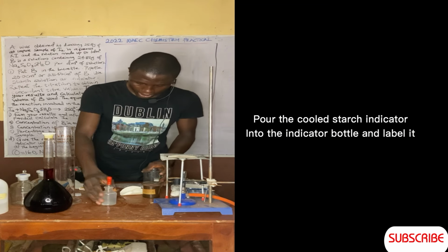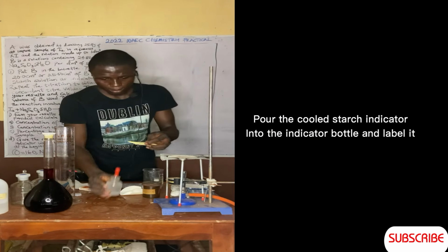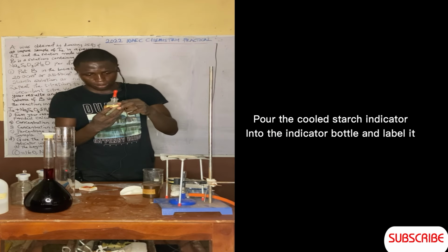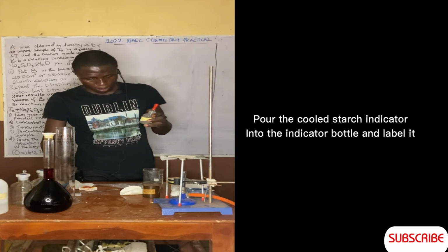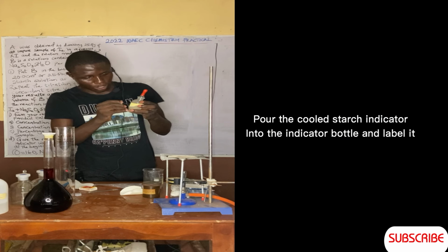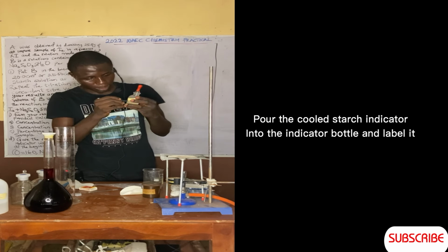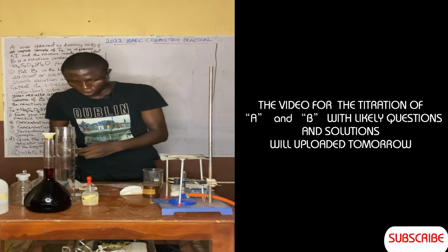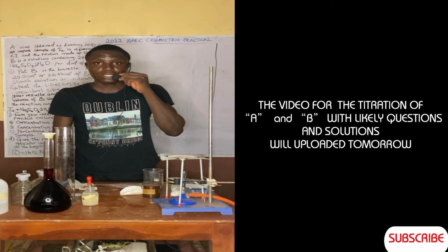So here's my indicator, let me label it. Starch indicator. So that's that about that. Now let's go into our titration.